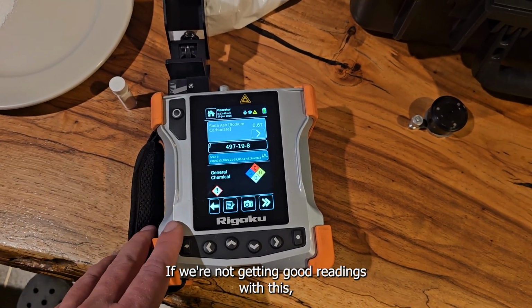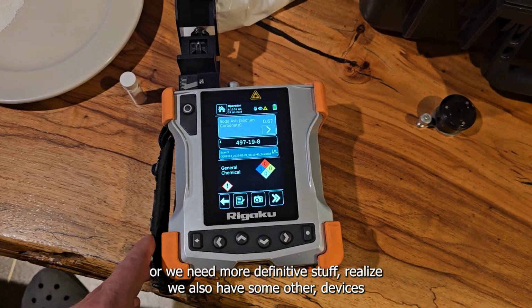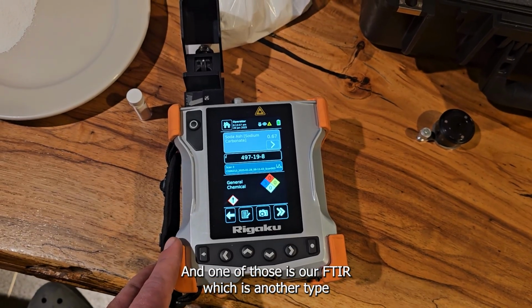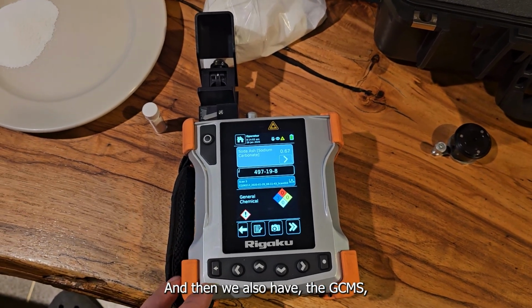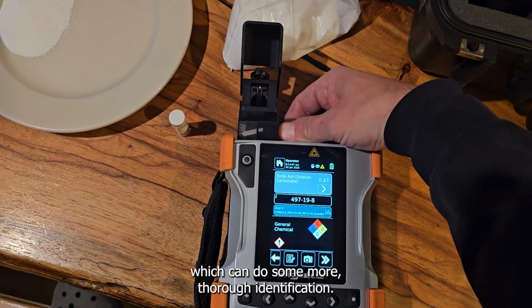If we're not getting good readings with this, or we need more definitive results, realize we also have some other devices that the science officers can bring out, and one of those is our FTIR, which is another type of laser device, which can do a couple different things. And then we also have the GCMS, which can do some more thorough identification.